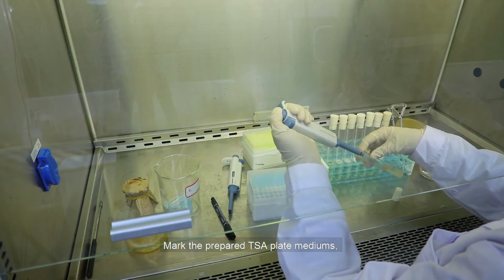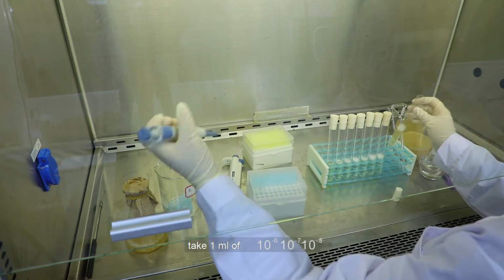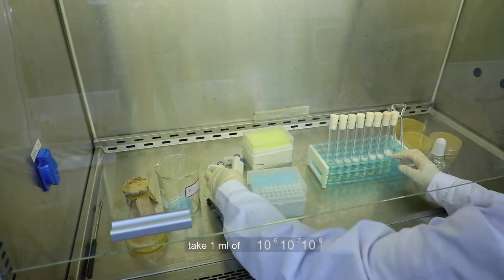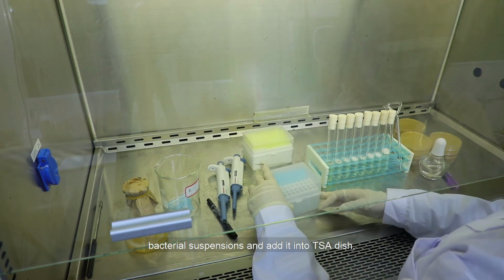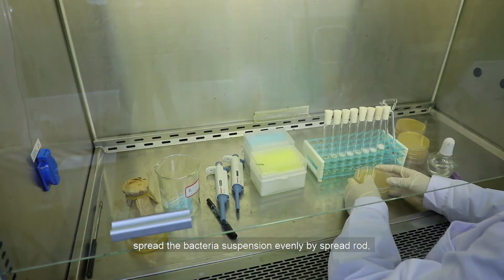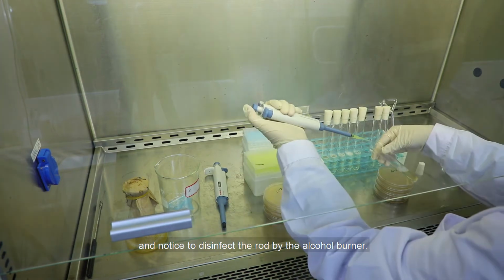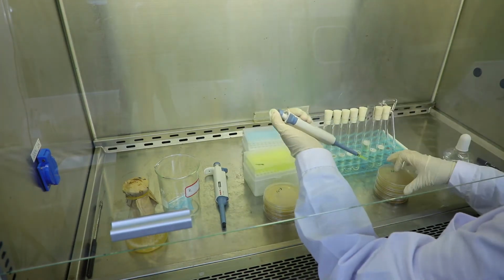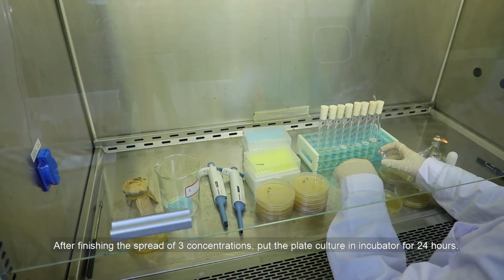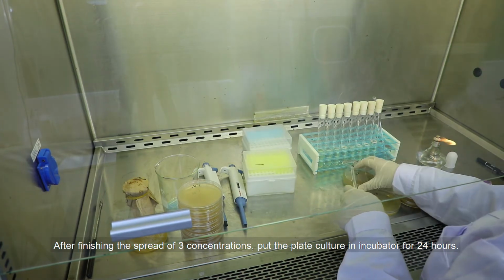Mark the prepared TSA plate mediums. Take 1 mL of 10 to the power of -6, 10 to the power of -7, and 10 to the power of -8 bacterial suspensions, and add them into TSA dishes. Spread the bacterial suspension evenly with a spread rod, and remember to disinfect the rod with the alcohol burner. After finishing the spread of 3 concentrations, put the plates in the incubator for 24 hours.